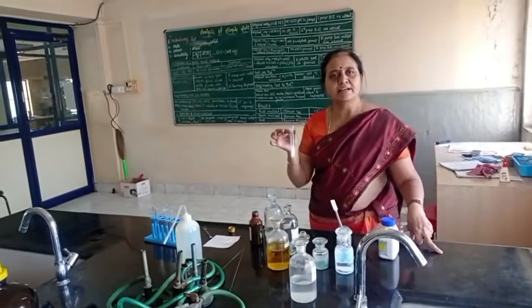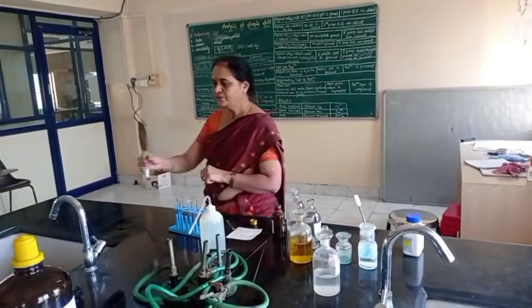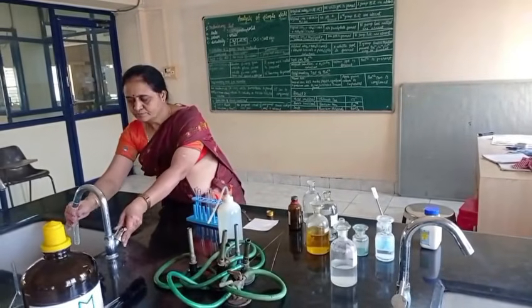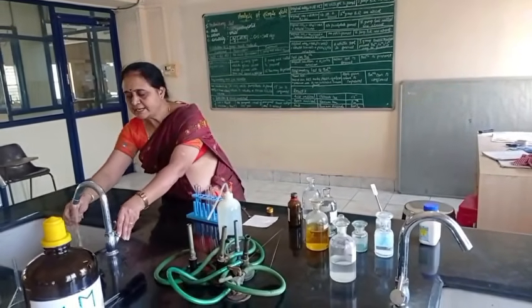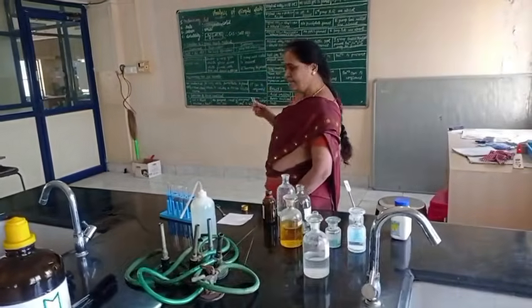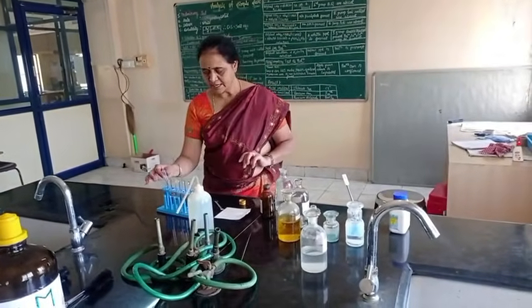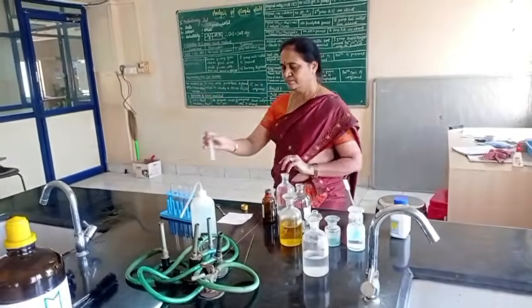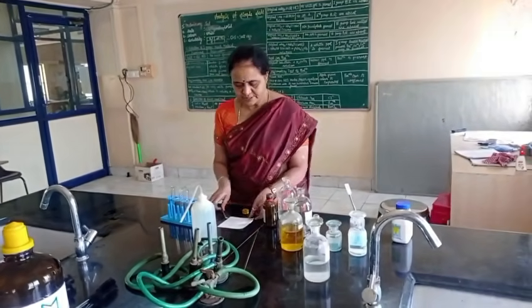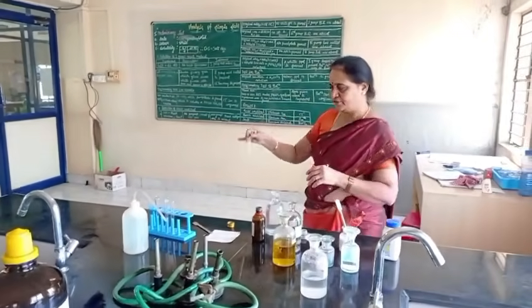Let us first check for presence of barium. Now I am going to conduct test for barium. So for this I take original solution.